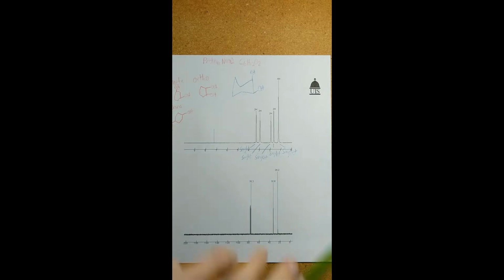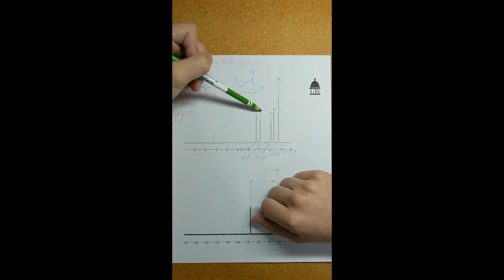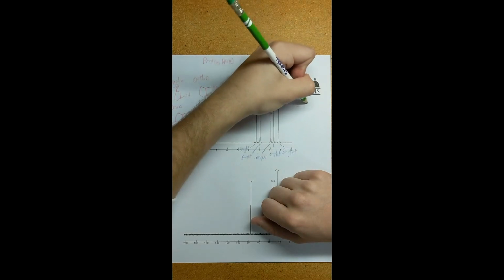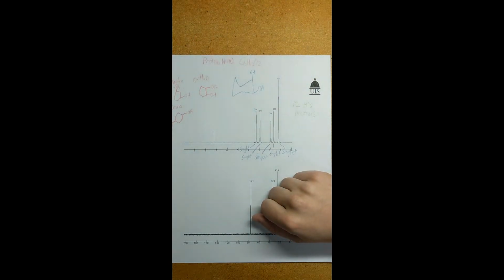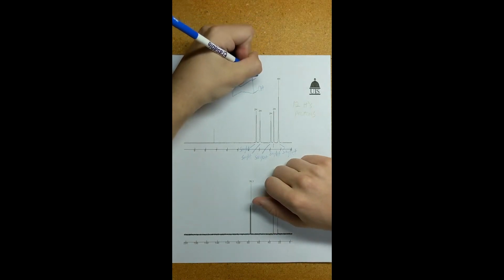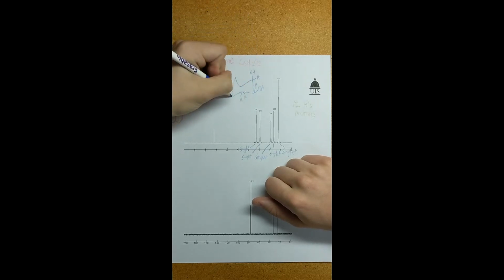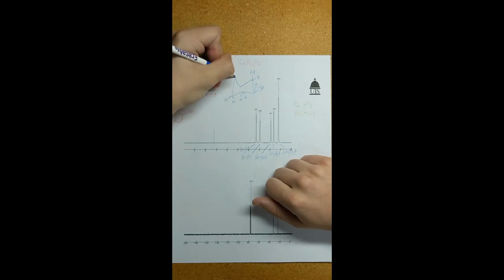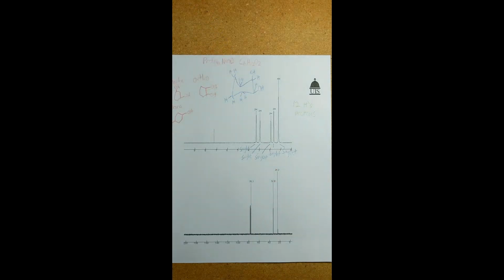But first, I just want to do a couple more housekeeping things. I want to make sure to label the integration here to make sure we do have the right number of hydrogens: 2, 4, 6, 8, 12. Perfect. 12 hydrogens or protons. As well as I want to label in the hydrogens on the chair structure to make sure those are correct as well. Filling the octets. One, 2, 3, 4, 5, 6, 7, 8, 9, 10, 11, 12. Perfect. That structure lines out well.